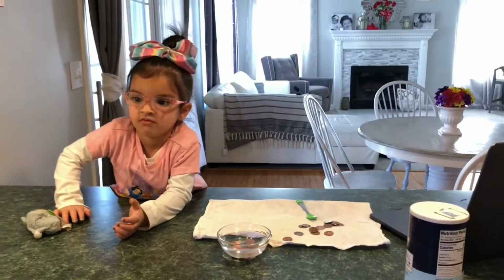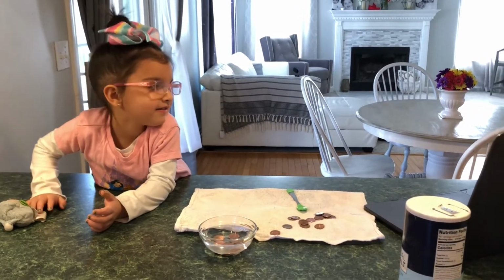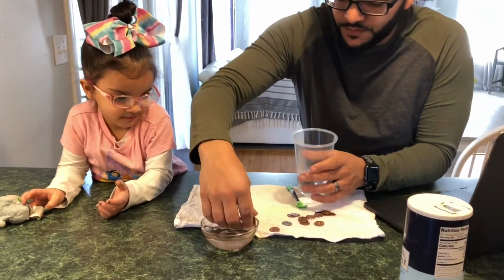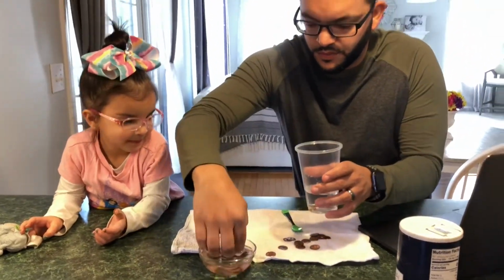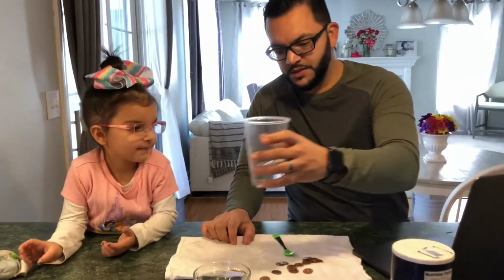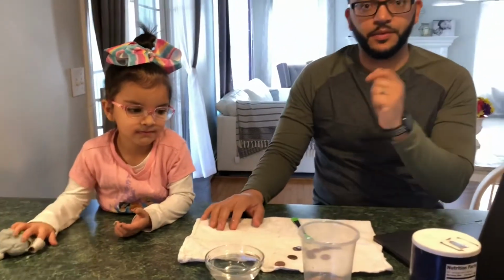So let's take these out, and we will stop the process that was occurring by placing them in water.